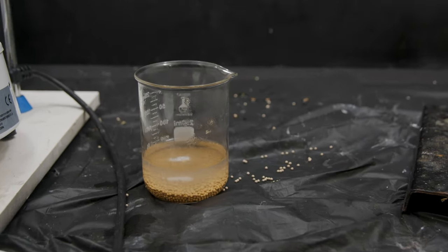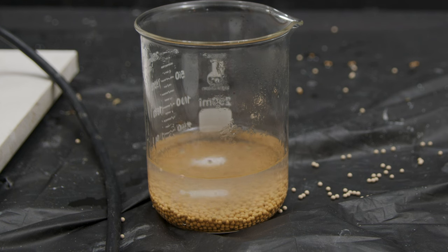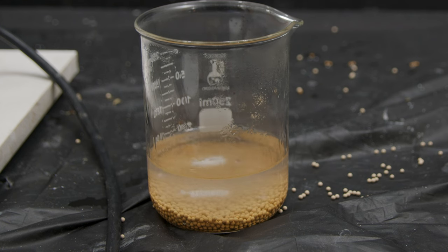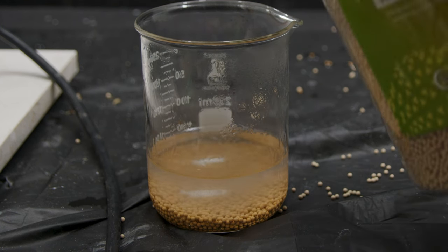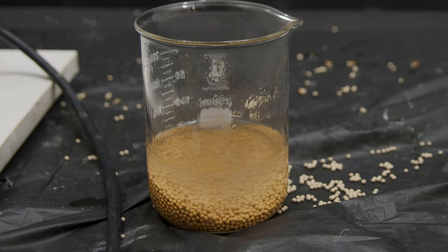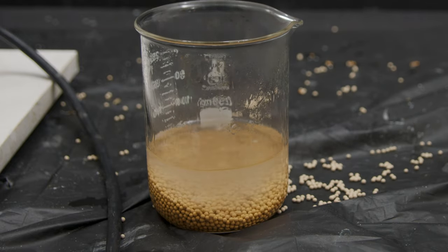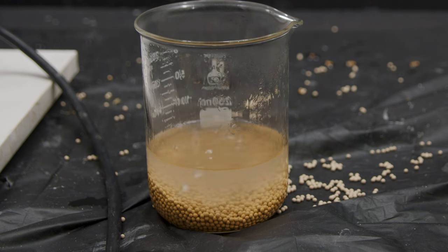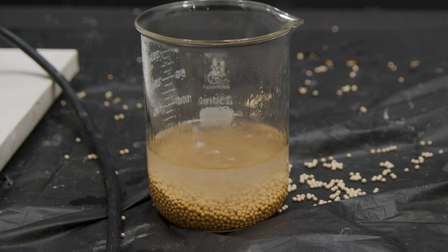Now admittedly you probably want to wait after distilling it for the alcohol to cool down a little bit. As you can see I didn't and now the alcohol is boiling. That's because when the water gets trapped in the molecular sieves it produces a little bit of heat. So yeah, go ahead and wait after distilling.